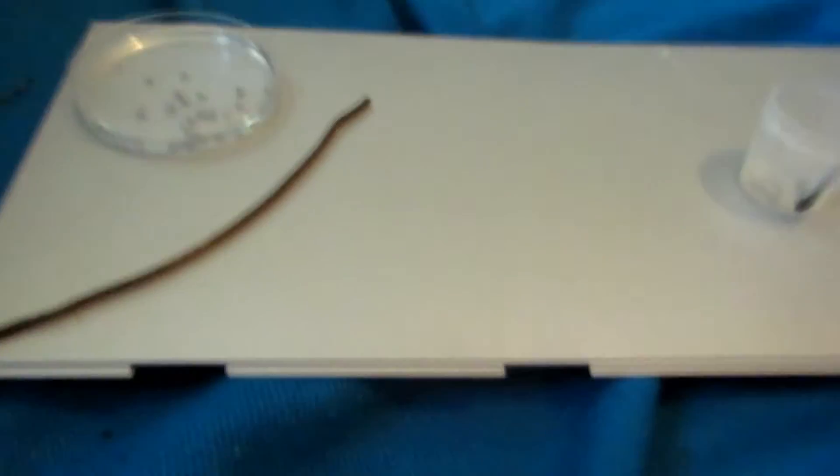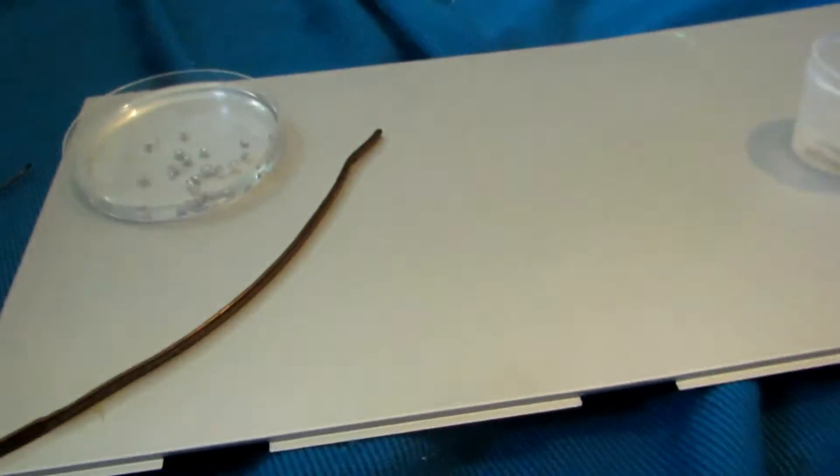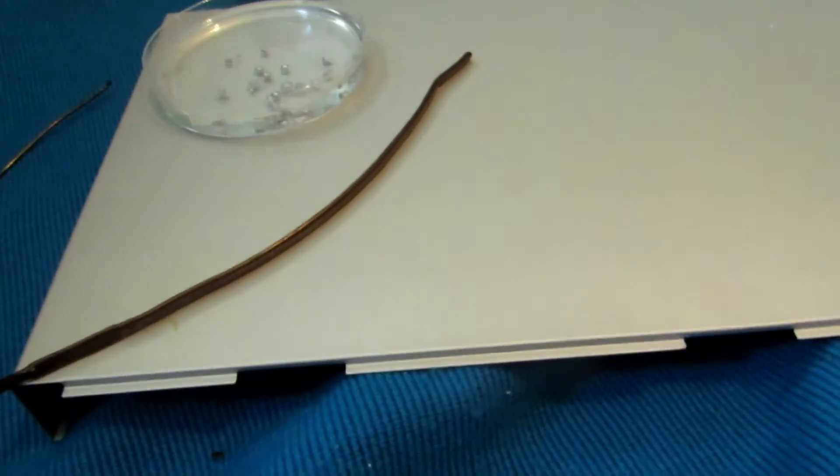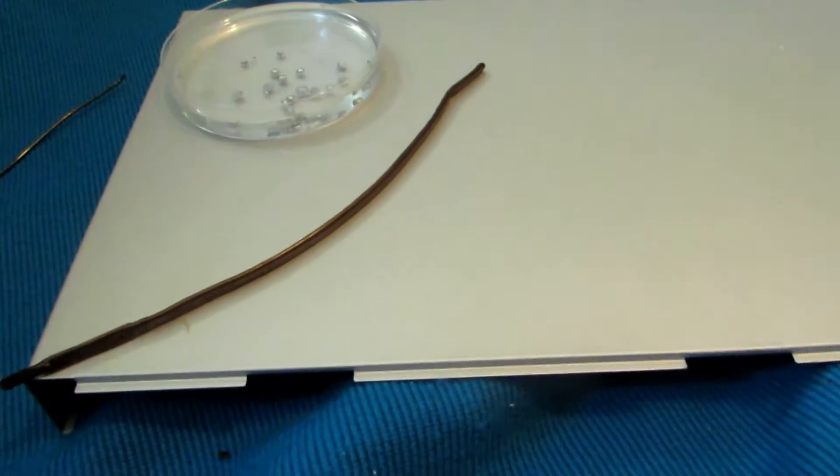Okay, so that's an example of how dangerous NaK is. It actually went right through my blanket here, through my tarp underneath, and ate through my carpet. So this is not very good, and I don't know how I'm going to explain that to my parents. Anyhow, so I have it on here now.